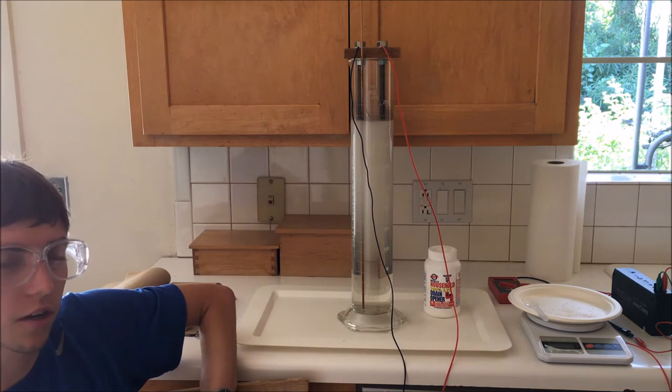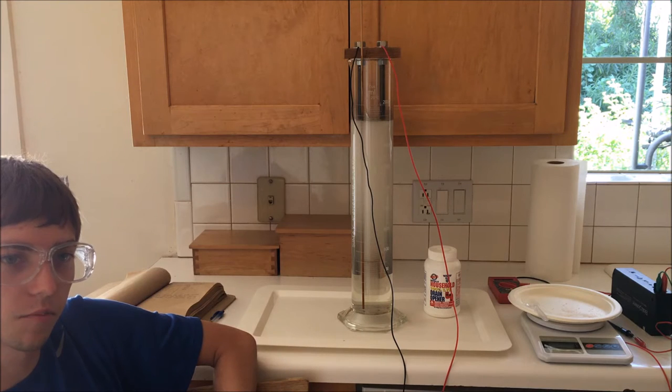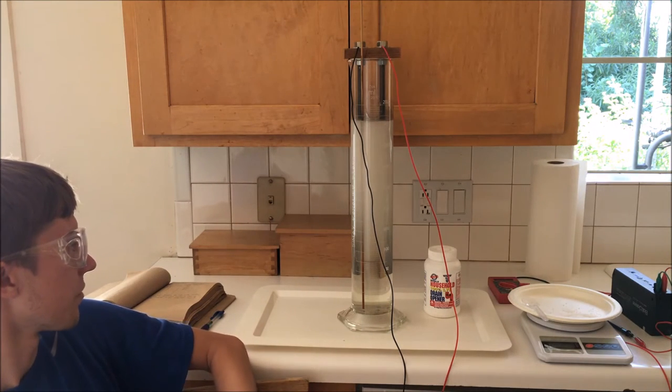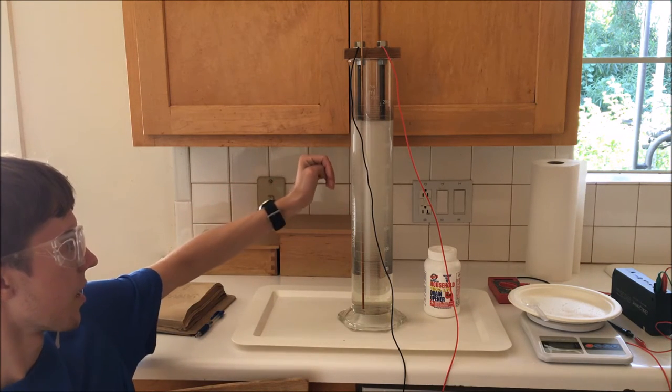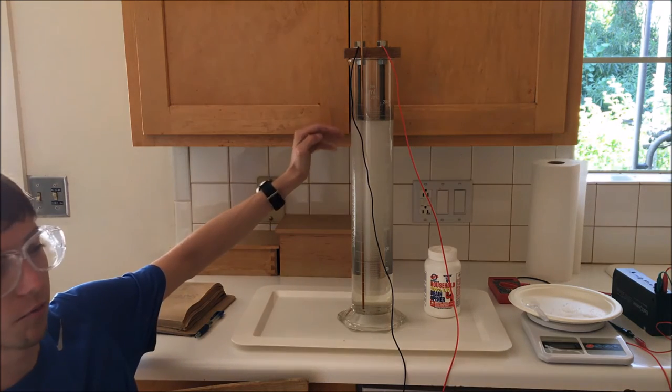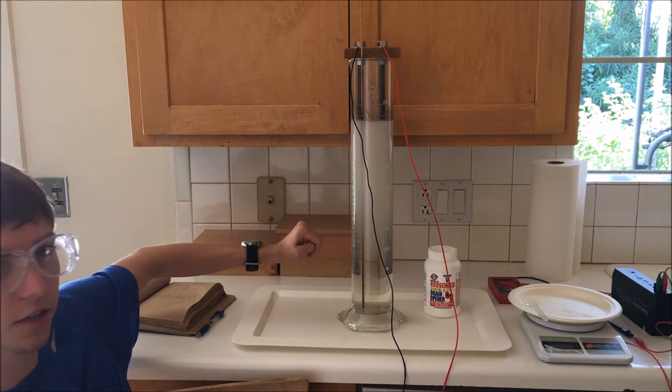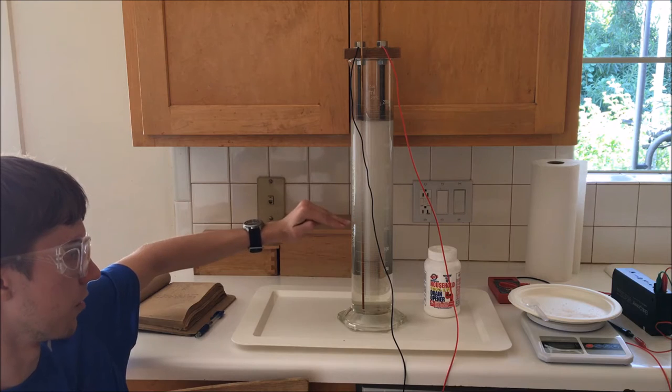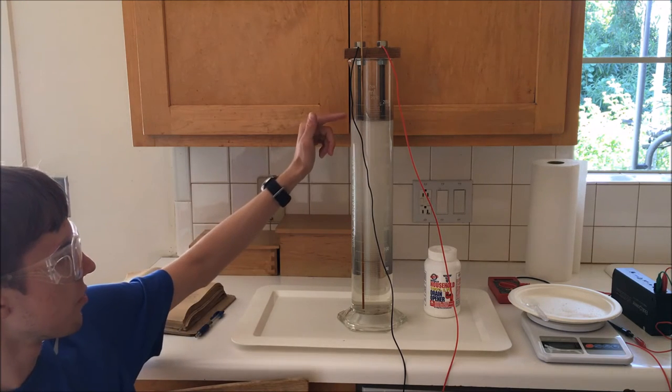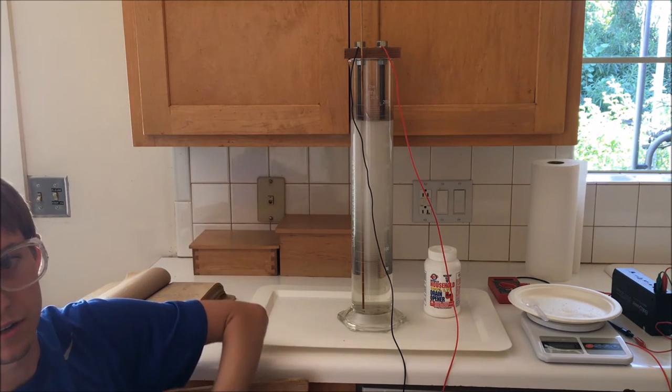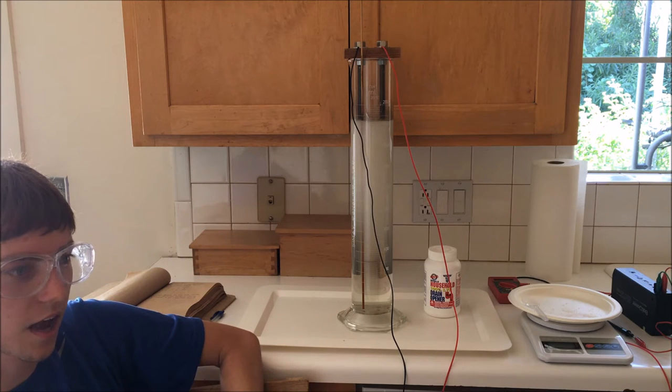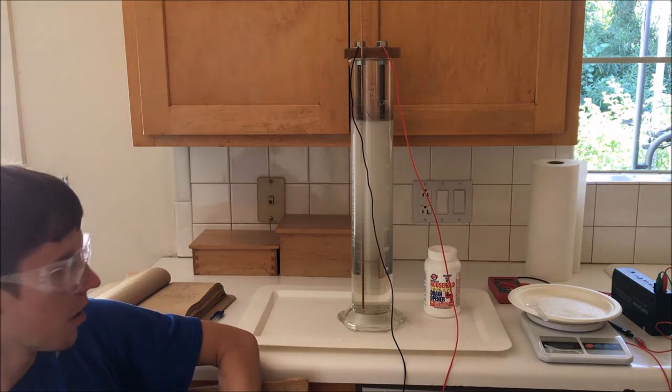Obviously, the solution concentration is going to increase considerably as the water level drops, but I'm hoping that will be made up for by the reduction in surface area of the electrode exposed as that level goes down. I'm going to try to keep the water level at 1800 milliliters throughout the week as much as I can after I've set it up in the future.